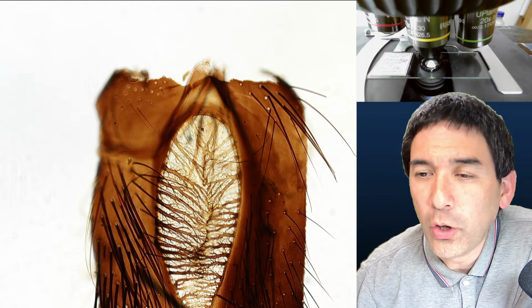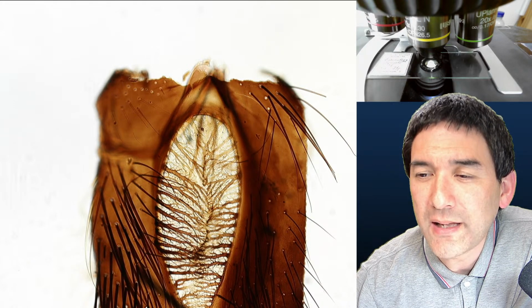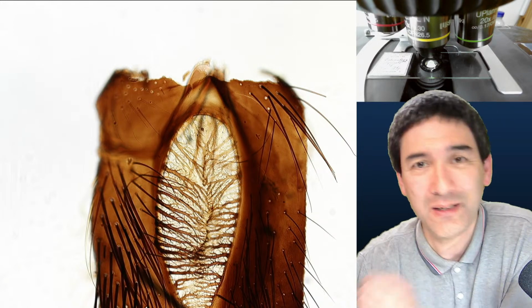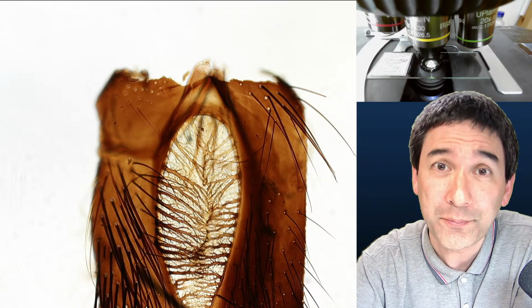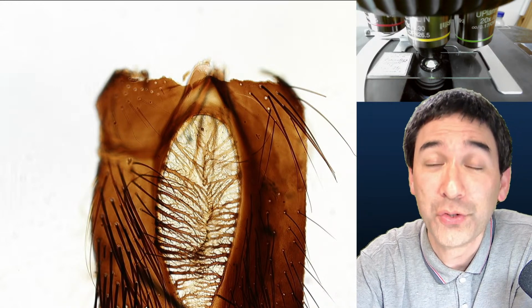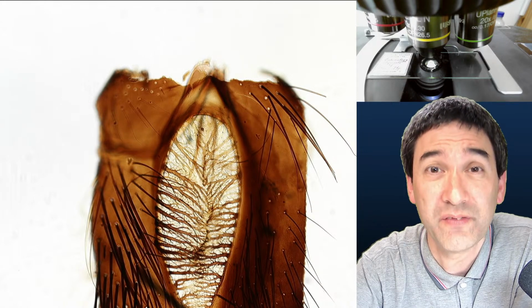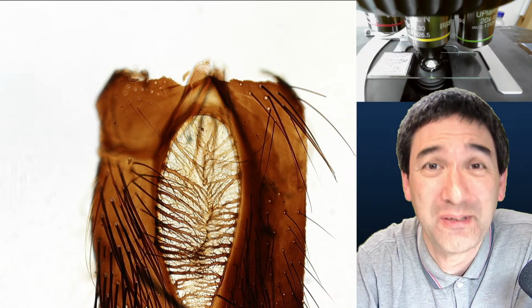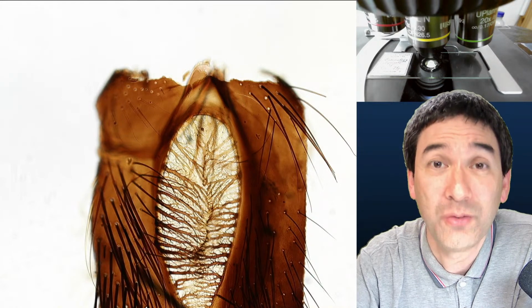Nice to imagine that a company on the slides might have made a business out of prepping specimens these days. We just seem to get plastic mass-produced ones. It depends really on the company. There are some high-quality microscope slide makers out there who are preparing very good slides, also for medical training. You won't believe what's available. Those companies do not sell the slide boxes over Amazon, but actually individual slides. Some of them can be fairly expensive. Some of them are also made on demand.